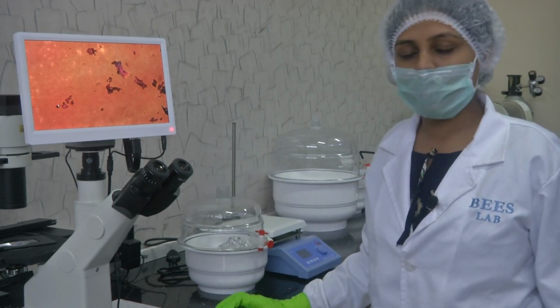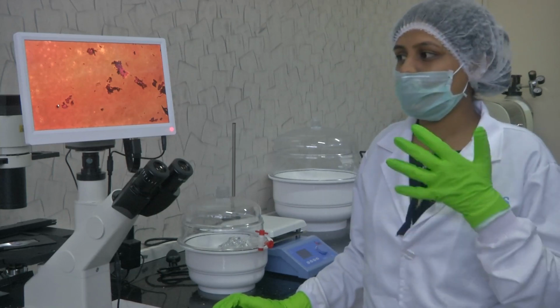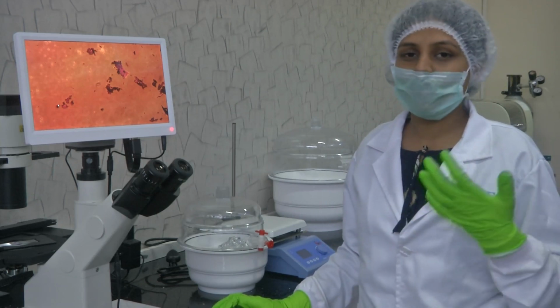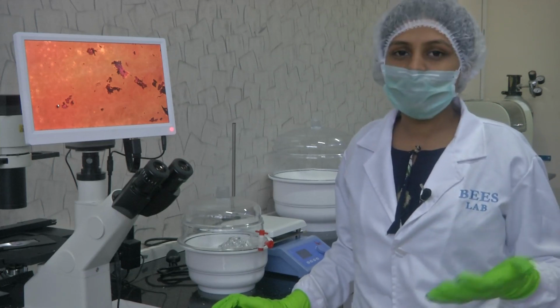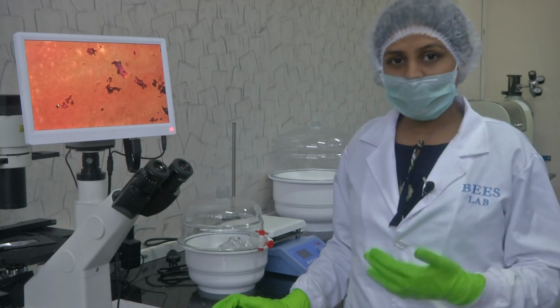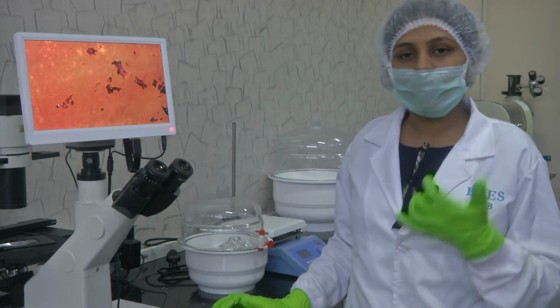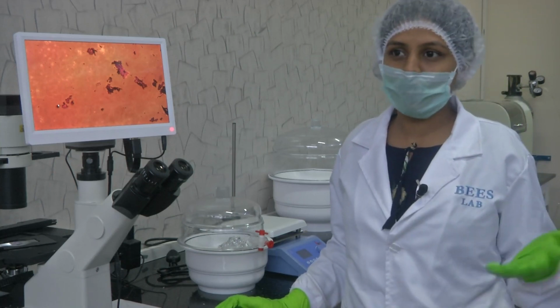So now that you have seen the utility, you know the right choice of microscope. If you are studying a biological sample, go with an inverted microscope. If you have an opaque object like a silicon wafer or any other metal coated device, then choose the metallurgical microscope. And if you just want to study the overall physical properties of a fabricated device and get proper 3D depth perception, then go with the stereo microscope.